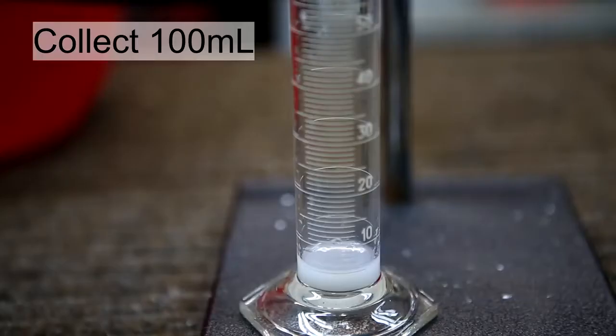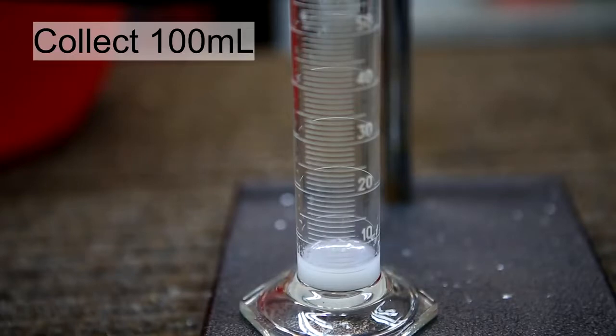For this reason the level of cloudiness is a good indication of how much oil is in suspension, so the more clear the distillate is the less oil that is present. With this information you can get an idea of when you should stop the distillation.